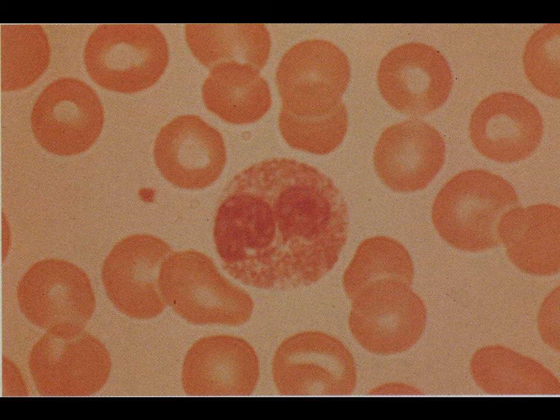Eosinophils. Eosinophils are almost always red in appearance. And so their cytoplasm stains very red, and so we see a red appearance to the cells themselves. They're very distinct when you're looking at a large span of a blood smear. Eosinophils do tend to stick out, but at the same time, they are relatively rare. And so it does take a bit of looking around a slide to be able to see those eosinophils that are there.